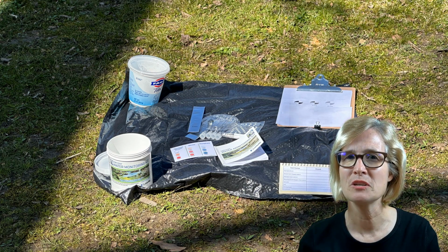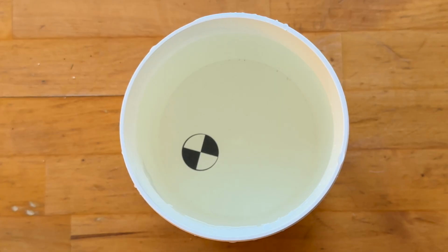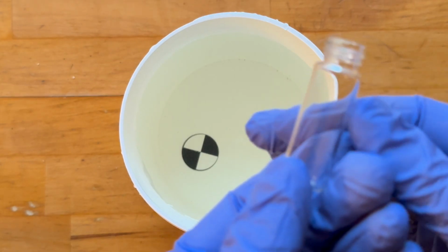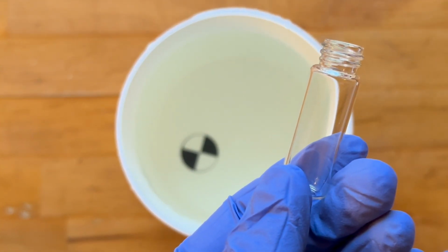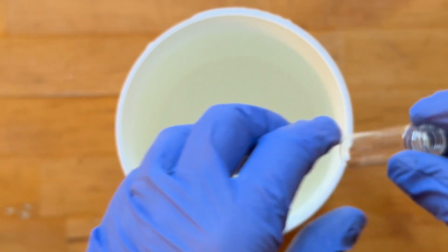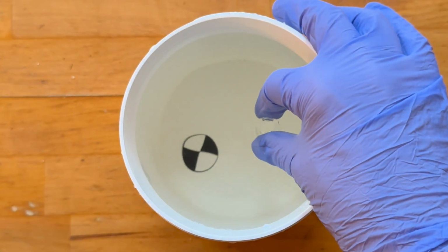But due to filming reasons, I will now be demonstrating the tests, but indoors. Now that I have my water sample, I am now going to start doing some of the tests. The first one is for dissolved oxygen. So I'm going to submerge one of the small tubes that came with my kit into the water sample until it's completely full.